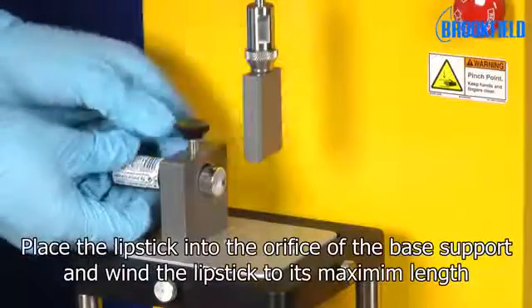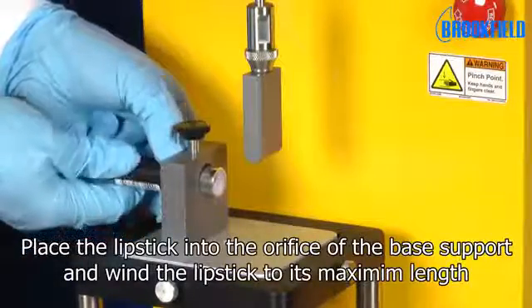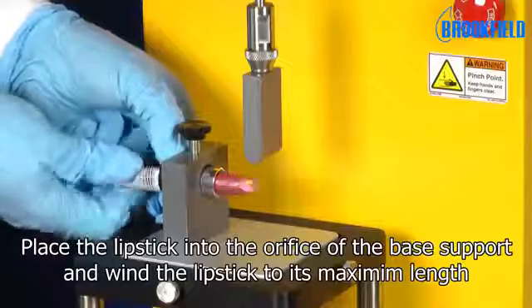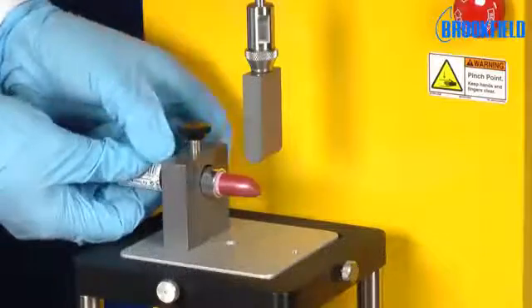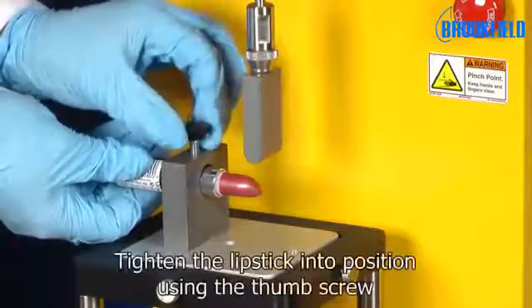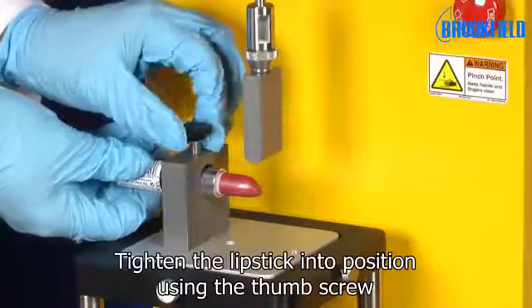Place the lipstick into the orifice of the base support and wind the lipstick to its maximum length. We can now tighten the lipstick into position using the thumb screw.